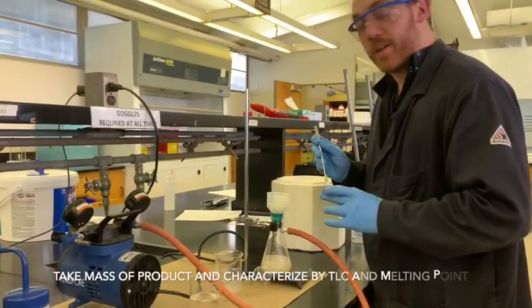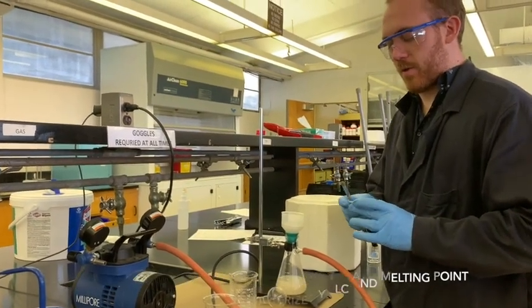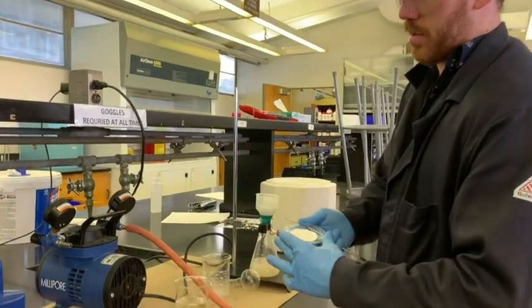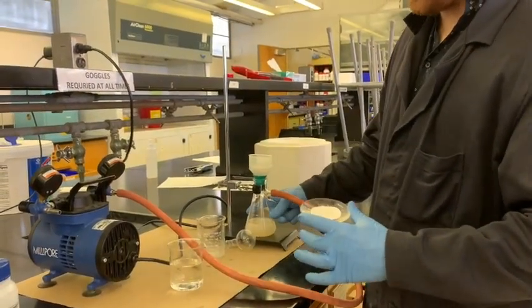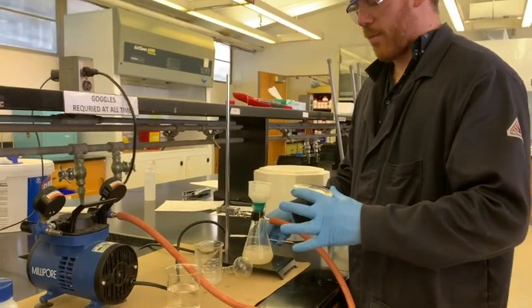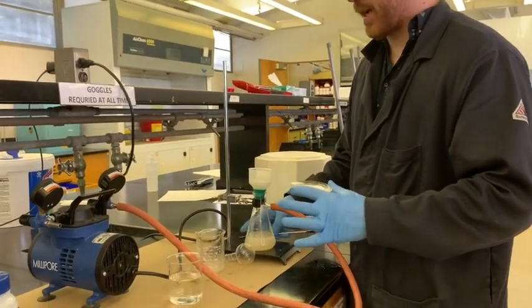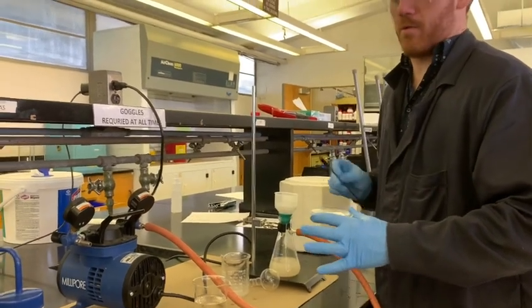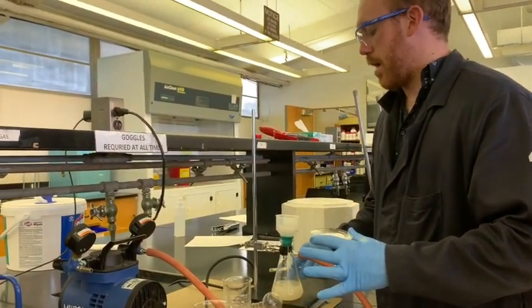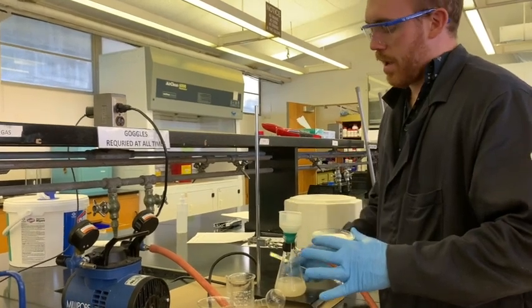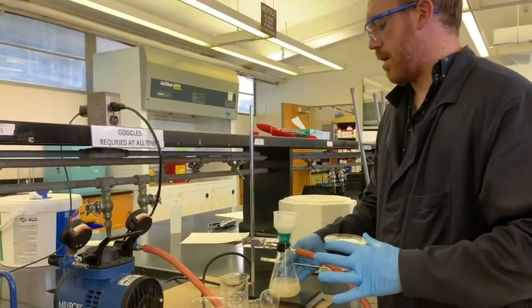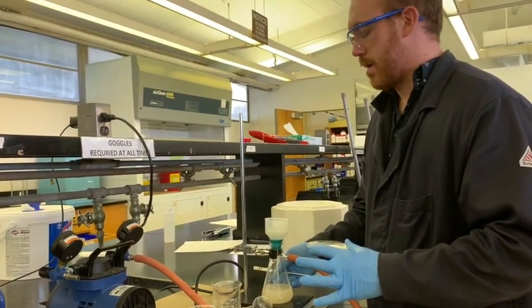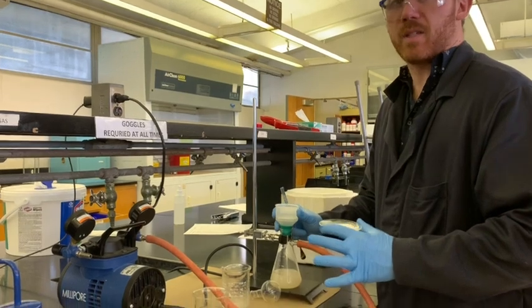So I just finished moving this into the watch glass or onto the watch glass here. We've got a little bit of product. There's a lot of hazy sort of precipitated product probably inside of the bottom of the filter flask. The portion that you would call the filtrate. This would be precipitate. But this is not really something that we want to go after right now. So we're going to try to focus next on weighing this, and then we're going to do the TLC and melting point.